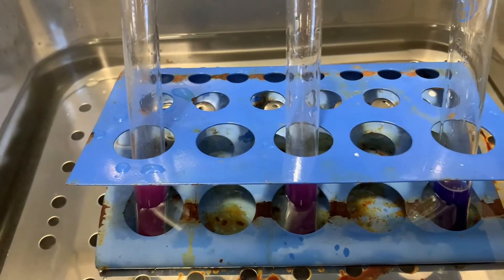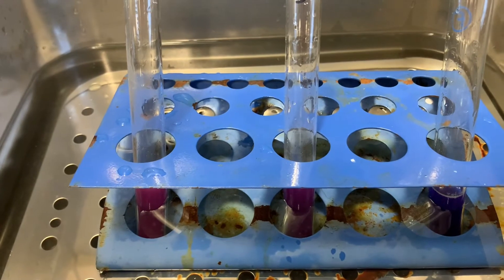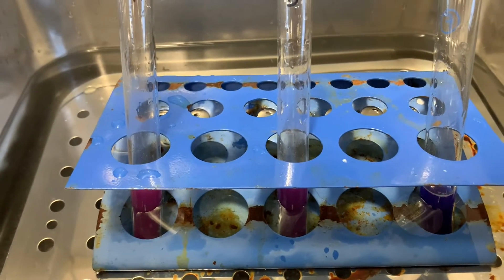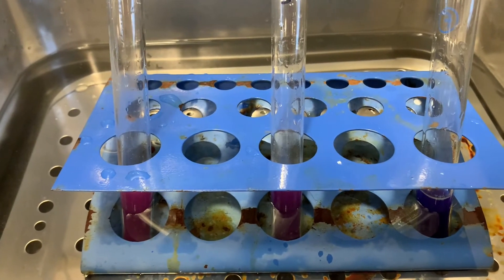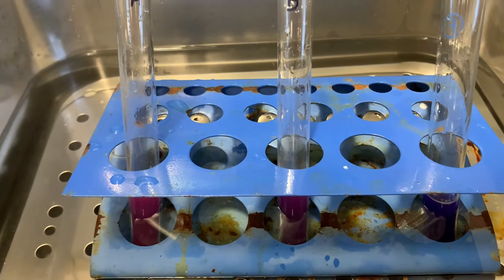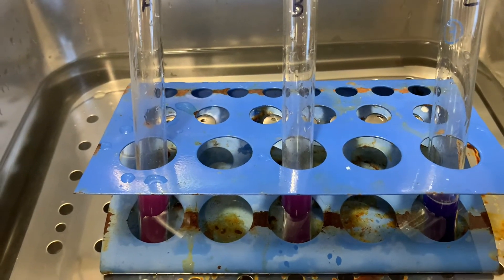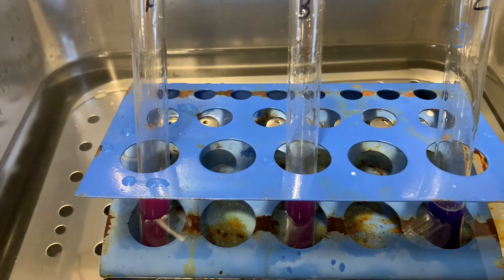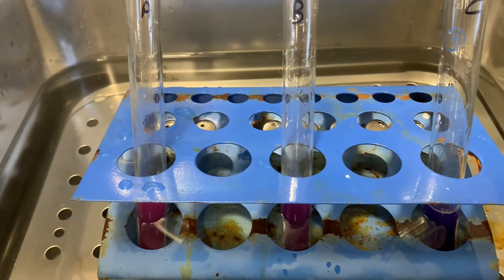A little update at about three minutes. You can see that our live yeast and glucose has got the biggest color change. There is a slight color change in the one with live yeast and water — you have to remember that live yeast will have some respiratory substrate within itself, so you would expect a little bit of a change, but not as significant as when they have access to glucose as a substrate.